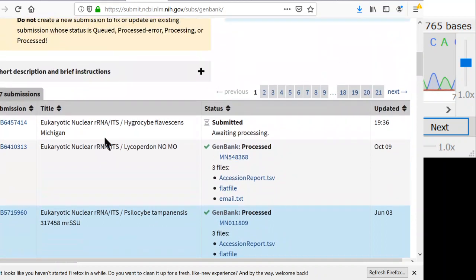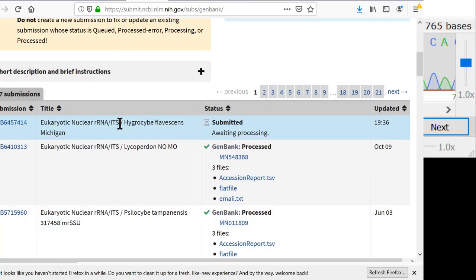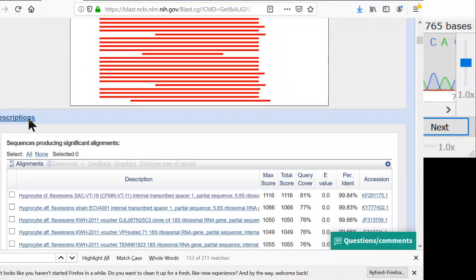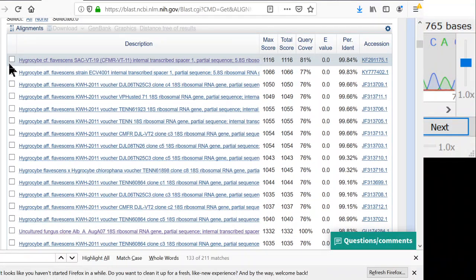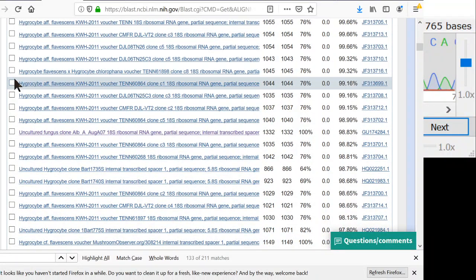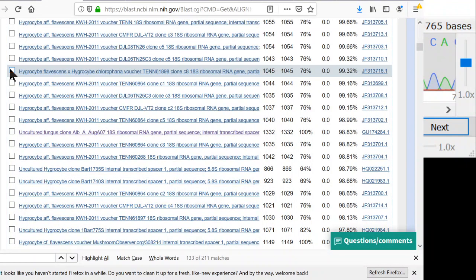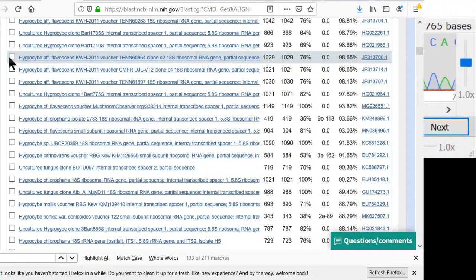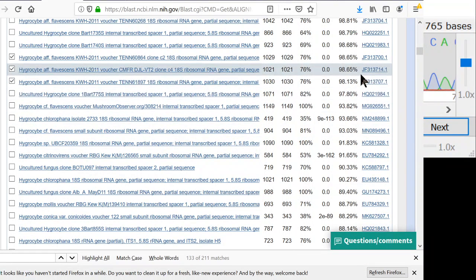One of the coolest things you can do with this data is to build phylogenetic trees. So I will show you how to do that. So back here, here's our BLAST. And what we can do over here with this checkbox is start selecting sequences. And I think our top sequence, we definitely want to select that. And these all look like they're the same species because they have the same identity. This one might be a really closely related species called Hygrocybe chlorophana. So I'll throw that one in there. And basically I'll just go down here and select whatever sequences I want to see in my tree. And here's another one that's claiming to be Hygrocybe flavescens, but this one is only 98% the same, so maybe it's a different species, like a sister species.